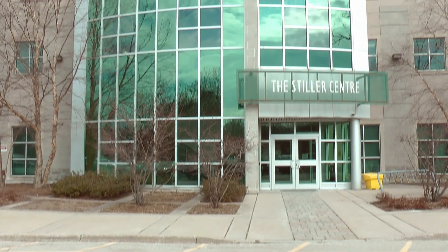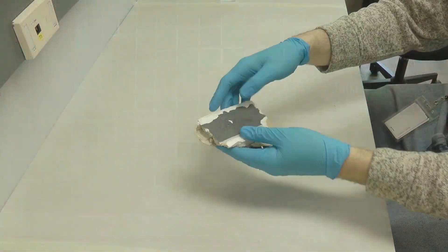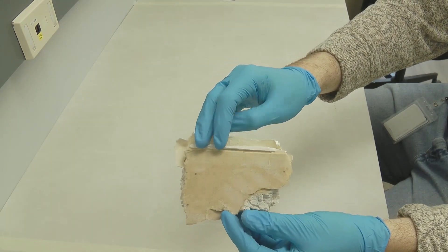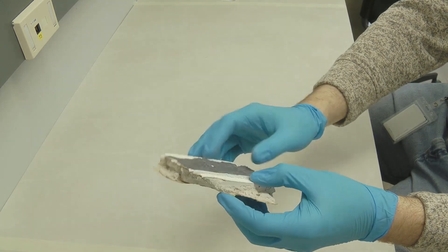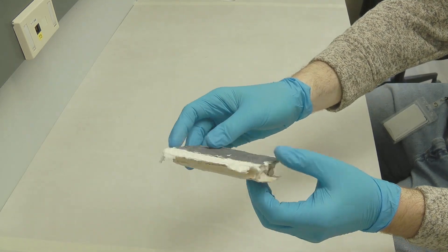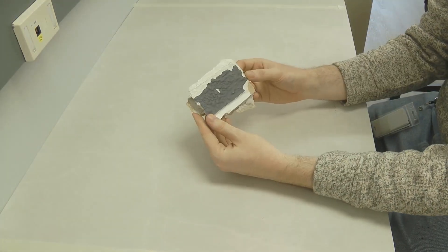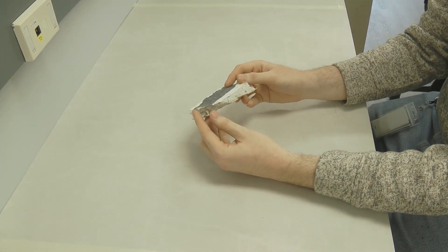Welcome to LCS Laboratories video library. There are different ways to evaluate mold contamination, and today we are exploring how to measure mold growth on surfaces. Mold is a natural microorganism and can be found in every house and every environment. It is not a question of if there is mold or not, but rather what kind of mold and how much.